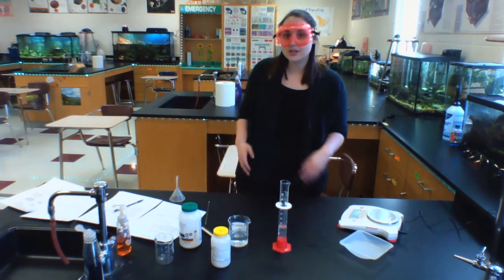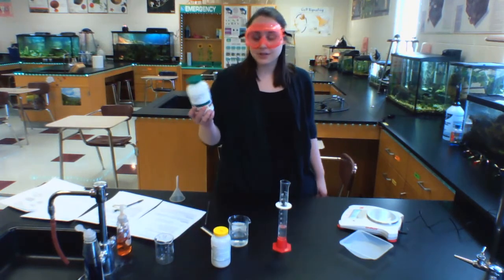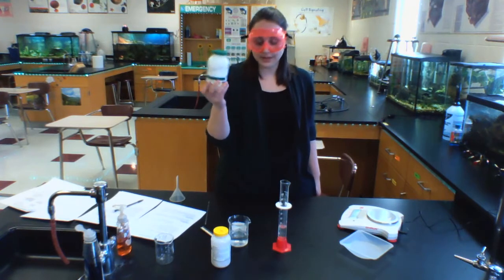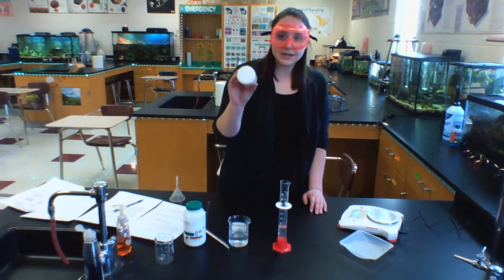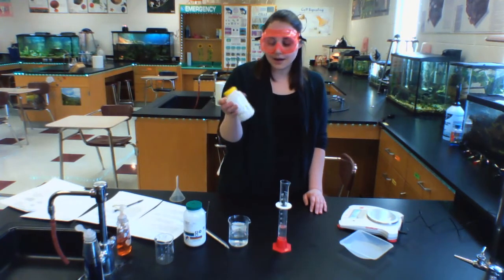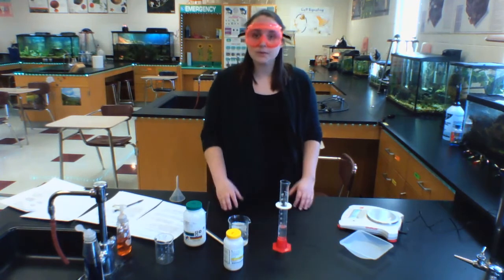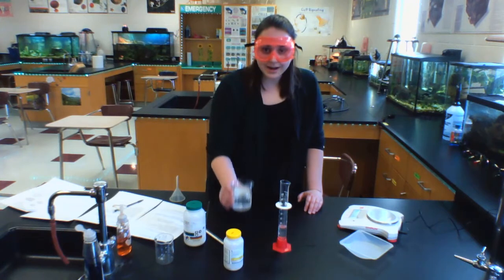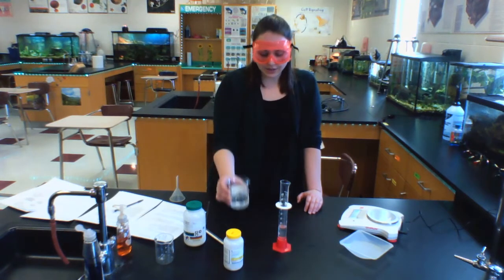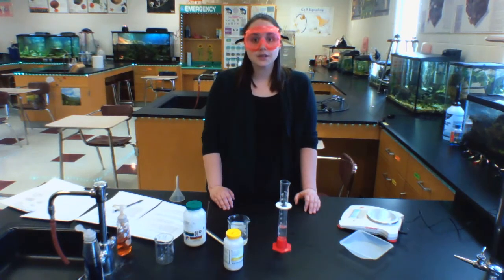So this reaction does involve two reactants. One is potassium iodide, which is solid. It's in powdered form here. The other is lead nitrate. So lead nitrate is also a powder, and you can't just combine those two powders and have them react. So what we did earlier, me and Miss Cook, is we made a lead nitrate solution. We dissolved lead nitrate into some water and made a solution out of it so that the reaction could then take place in that liquid solution.